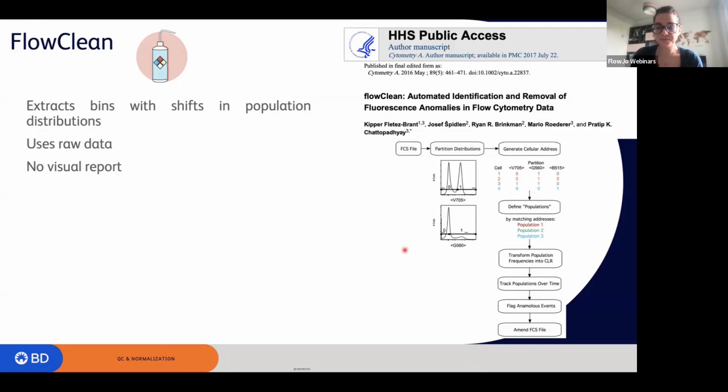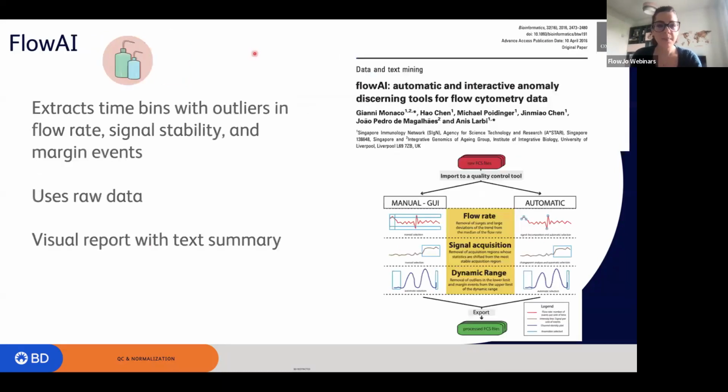After FlowClean, FlowAI was released. FlowAI is another algorithm that actually makes three different checks, not only one on the flow rate: it checks the flow rate, the signal acquisition, and the dynamic range. Whenever you have drops or spikes in the flow rate, this algorithm identifies these alterations and removes the events within this interval of time. The same goes for whenever there is a change point in signal acquisition, or when there are events outside of the dynamic range of the instrument, which could be either negative or positive events.